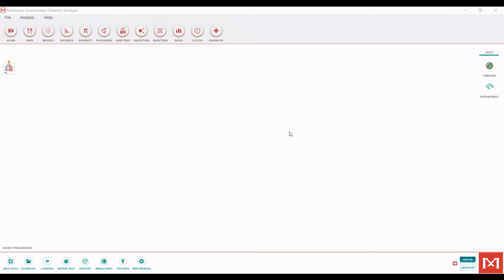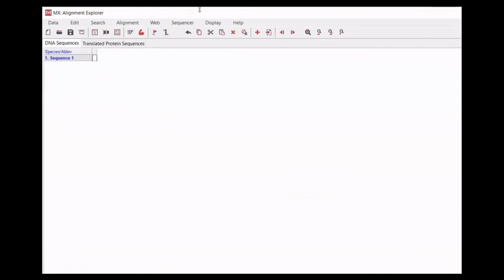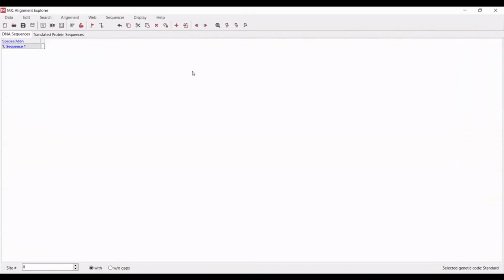It will also then ask you, actually, I think I could probably switch which screen I'm sharing. Here we go. Okay, so it will ask you, I'm not sure if this pop-up shows up, data type for alignment, whether you are looking at DNA or a protein sequence. We are looking at DNA, so that is what I'm going to select. Okay. And so this is what opens.